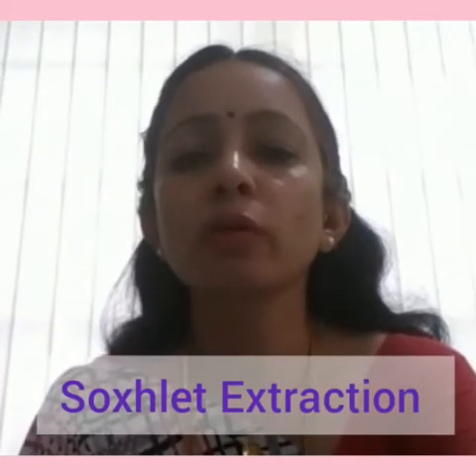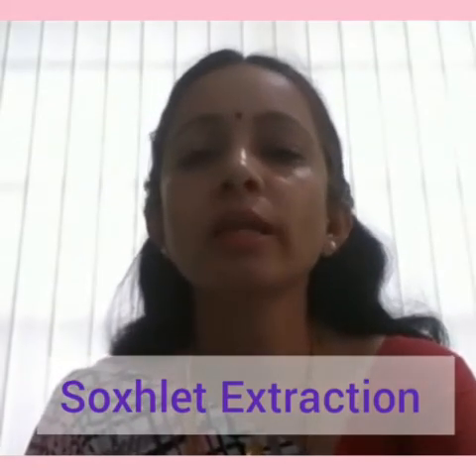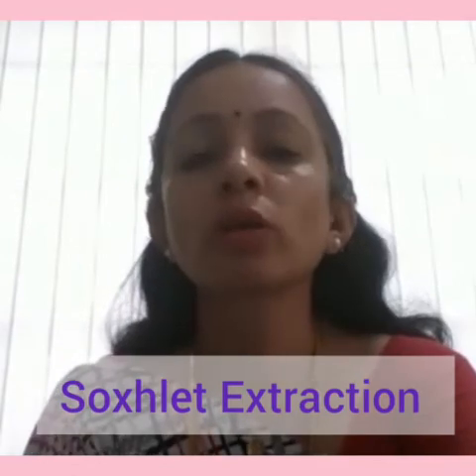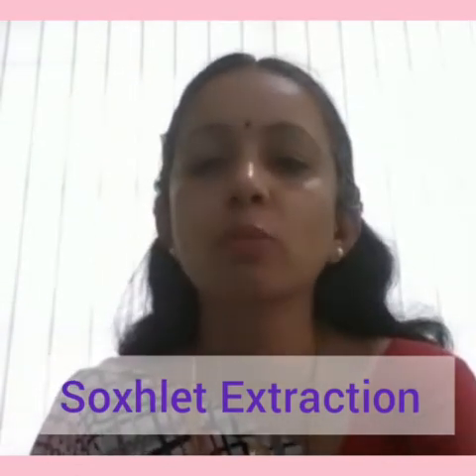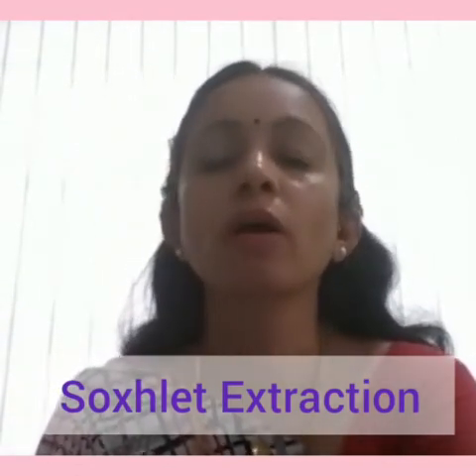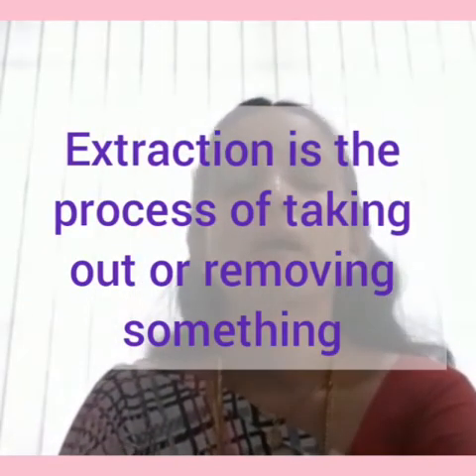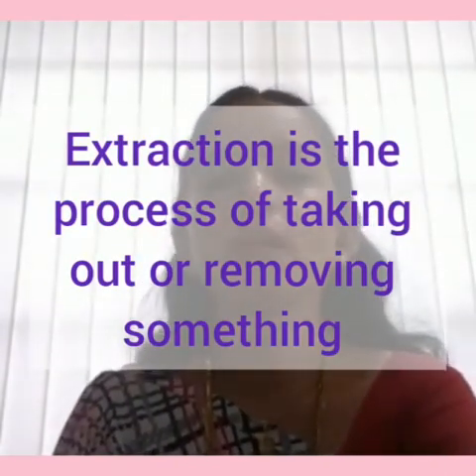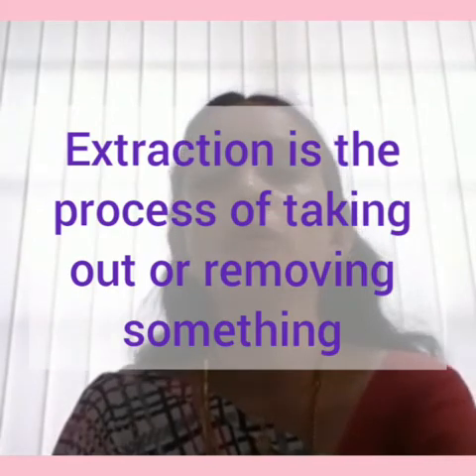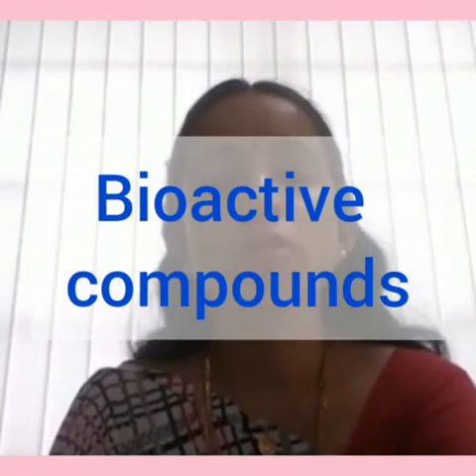In today's video we are going to see about Soxhlet extraction. Extraction is a process of removing or taking out something. Soxhlet extraction is a technique which is widely used for extracting valuable bioactive compounds from various natural sources.